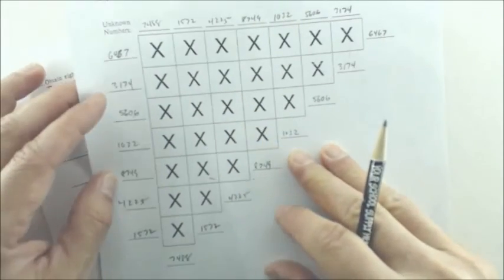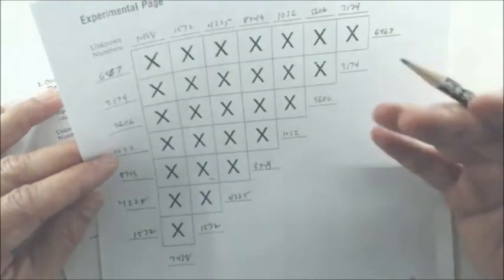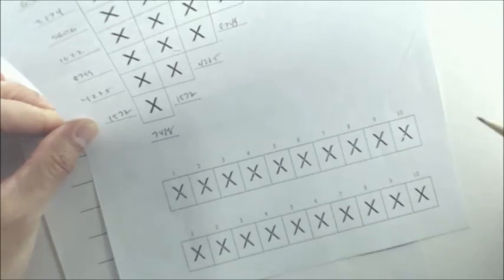And then you'll be able to slip this into the page protector and do your reactions right here. As a starting point, just to see what kinds of precipitates, if you get any bubbles, what color precipitates you have, so you have something to compare to the knowns grid that we did. There's also a couple of rows of X's down here at the bottom, and those rows are for you to do some additional testing of your unknowns with your knowns. You should do the same set of numbers you did here, duplicate that over here. And then this is for taking notes, and you've got some extra space to jot down some ideas of what you want to test next and things like that.